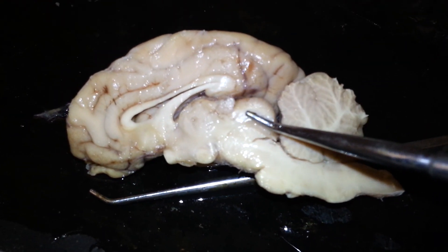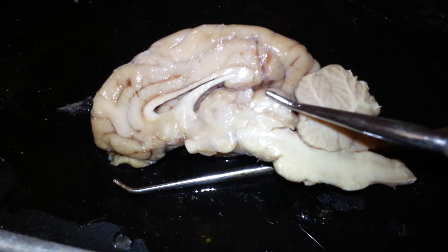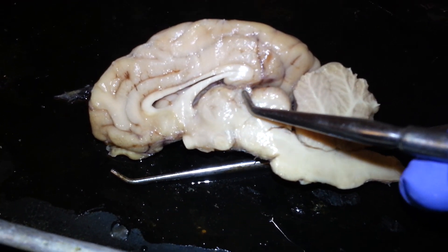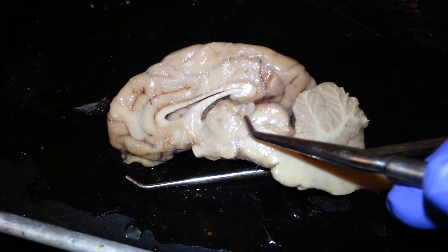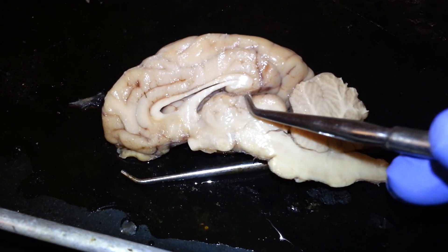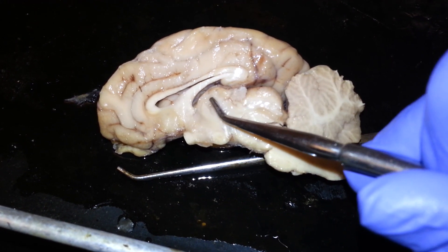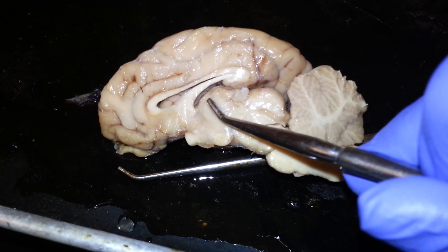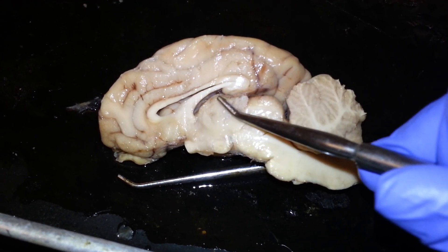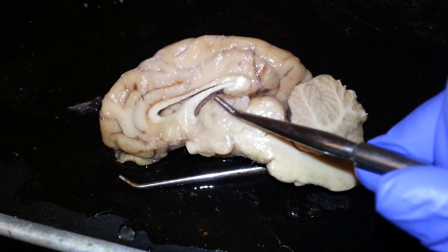Moving on, anterior to the corpora quadrigemina, you have the pineal body — this round part right here. And then anterior to that, you have the thalamus, or what's sometimes known as the intermediate mass of the thalamus.